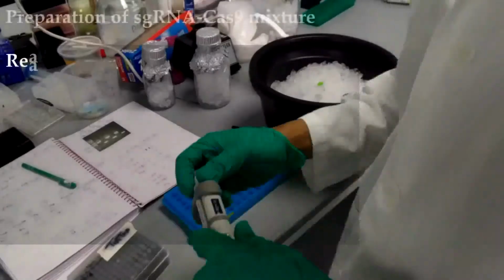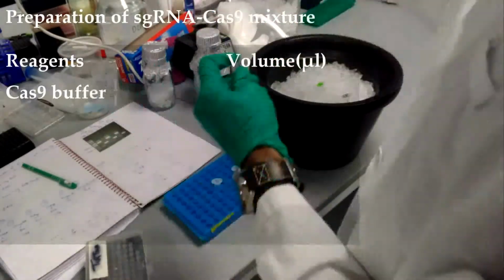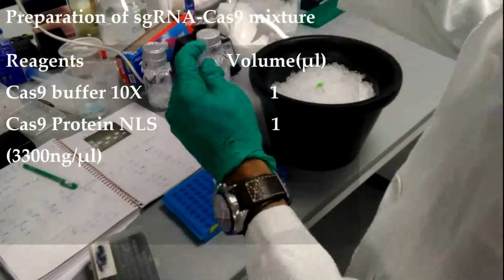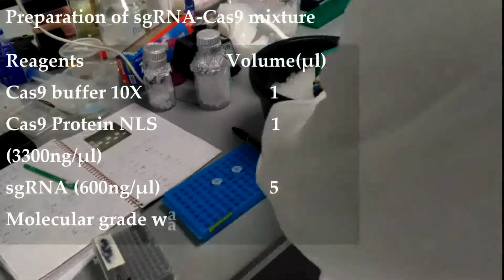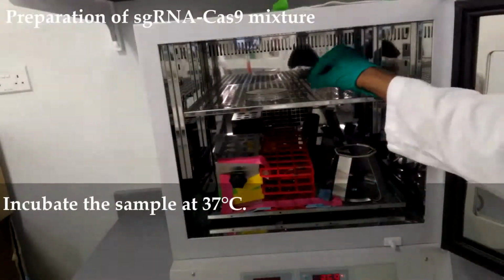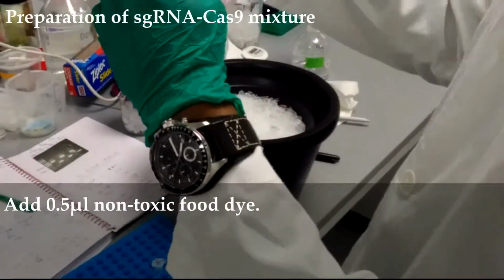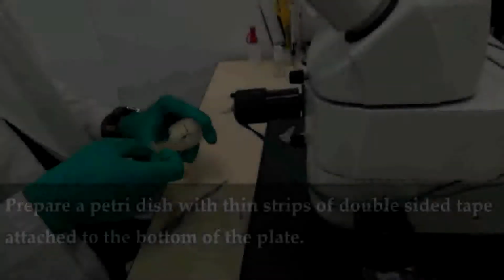Preparation of sgRNA Cas9 mixture. In a 1.5 ml microcentrifuge tube, add 1 microliter Cas9 buffer 10x, 1 microliter Cas9 protein, 5 microliter sgRNA, and 3 microliter molecular grade water. Incubate the sample at 37 degrees Celsius for 10 minutes. Add 0.5 microliter non-toxic food dye. Vortex the mixture.